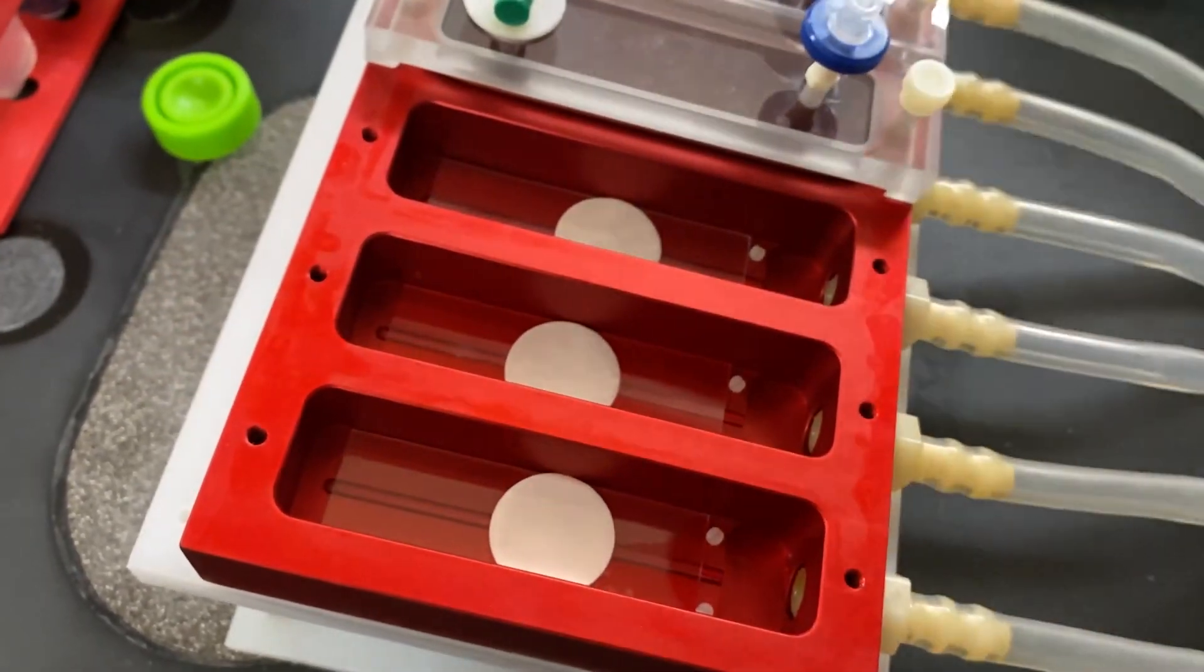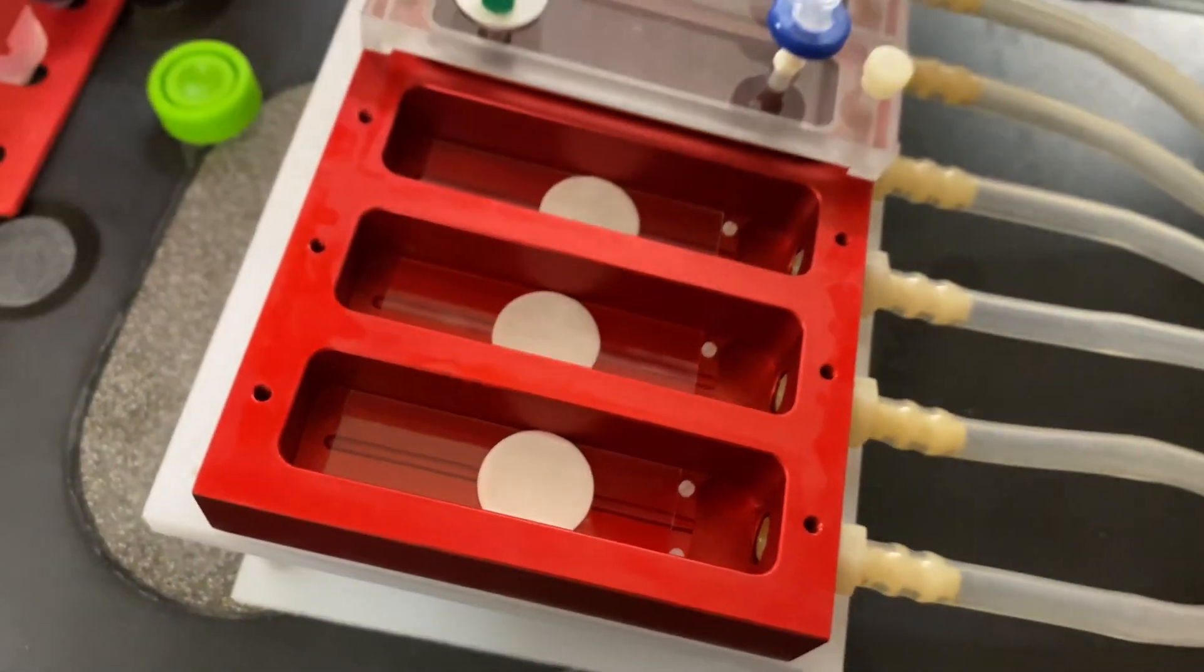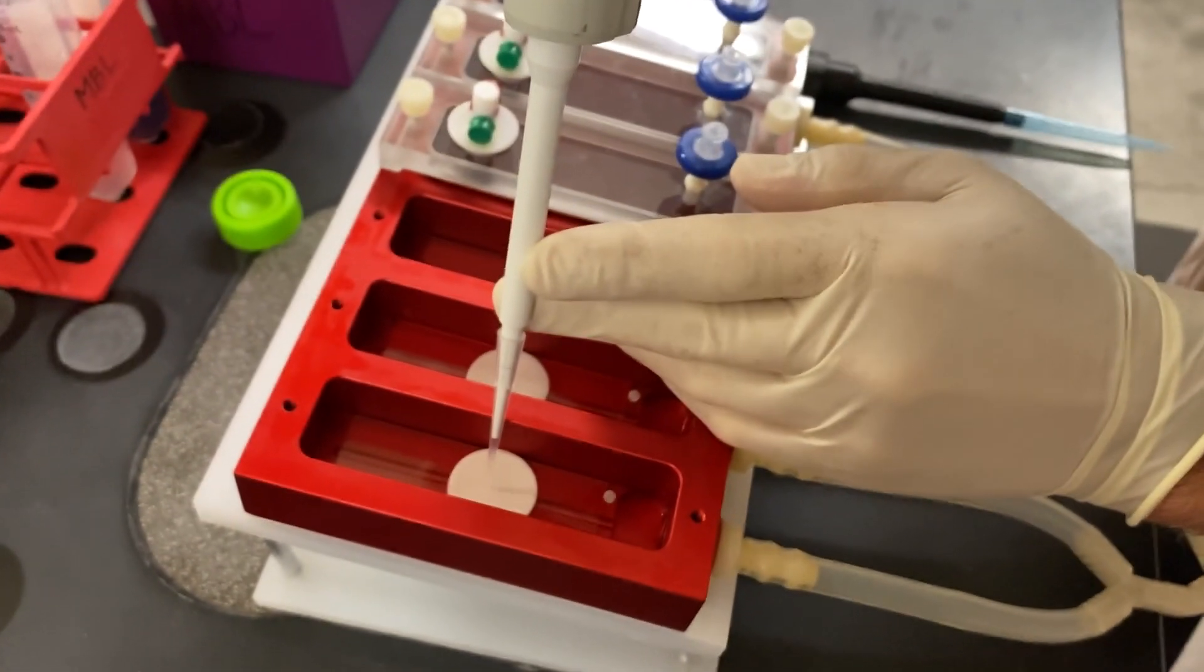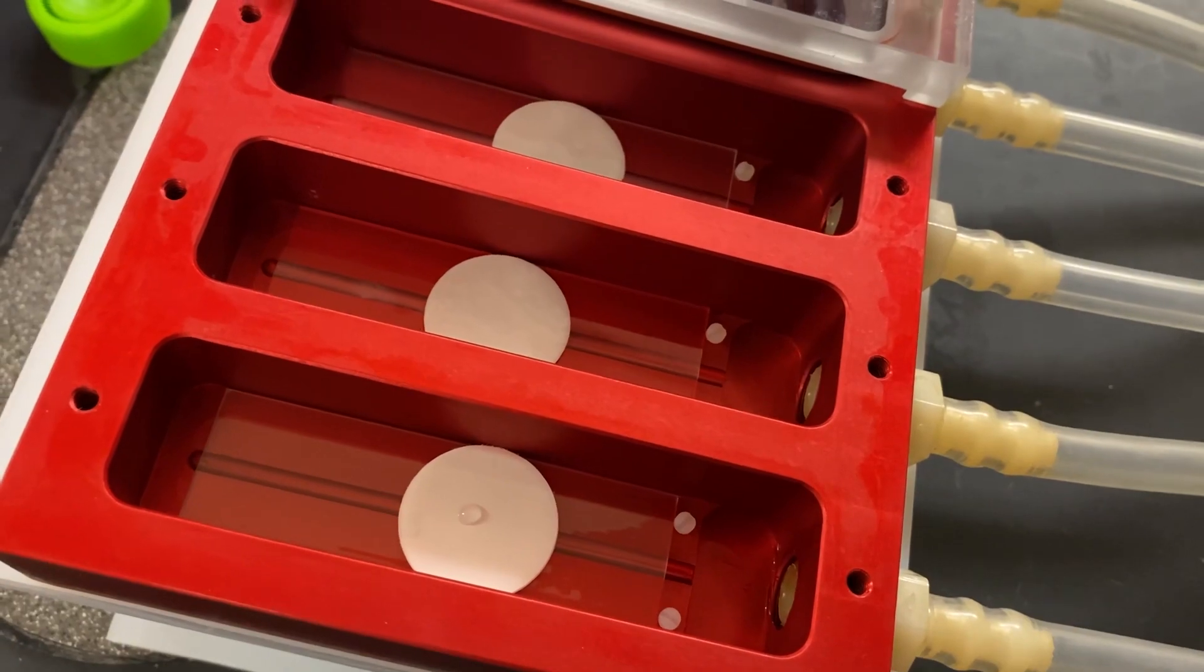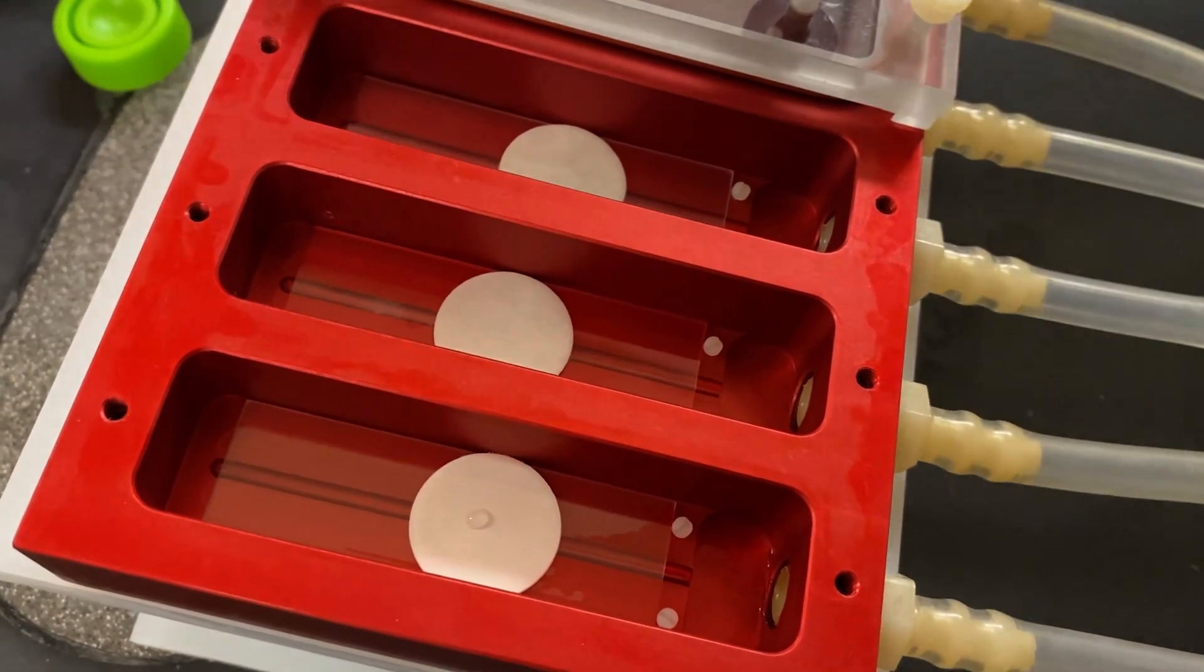We then inoculate the membrane with a 10 microliter drop of the microorganism. We then let the drop dry and close the reactor and hook it up to a medium reservoir and pump.